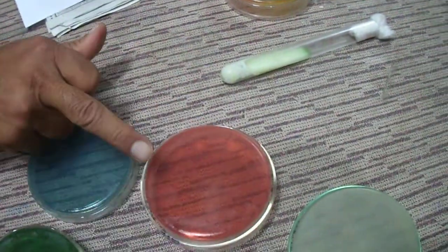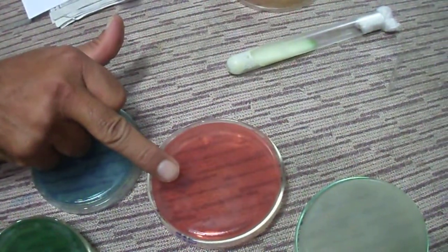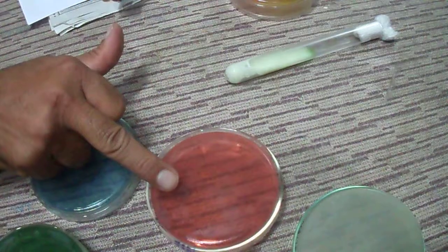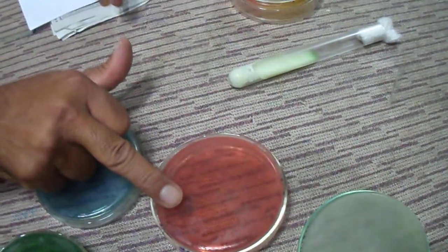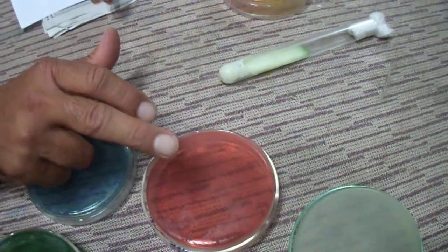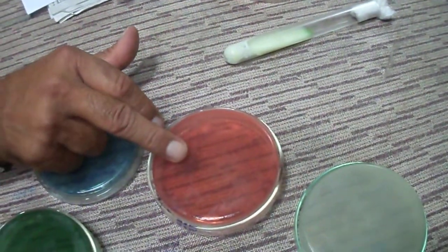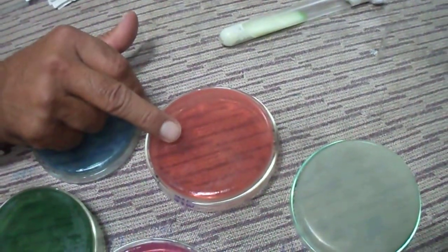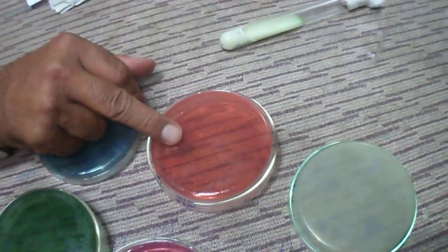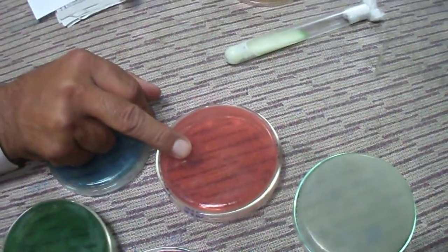MSA. What do you think about it? Staphylococcus aureus. Staphylococcus epidermidis. Staphylococcus aureus.